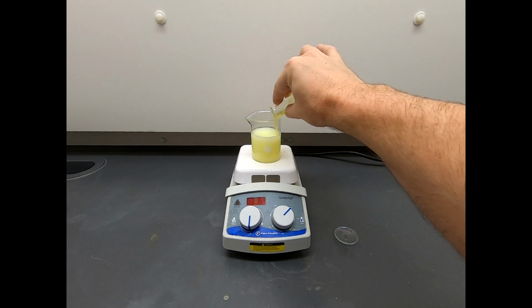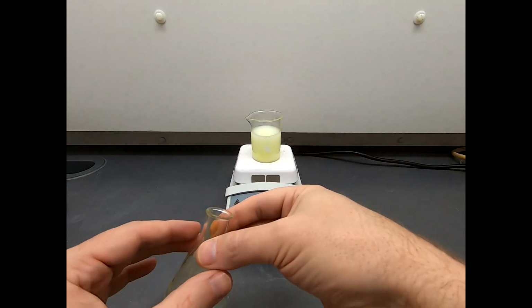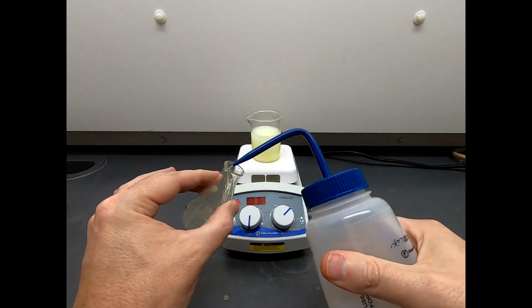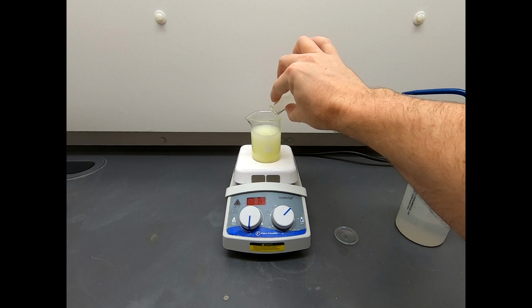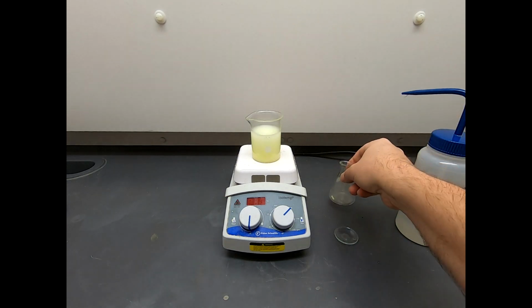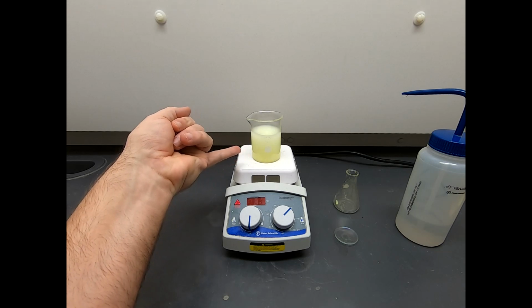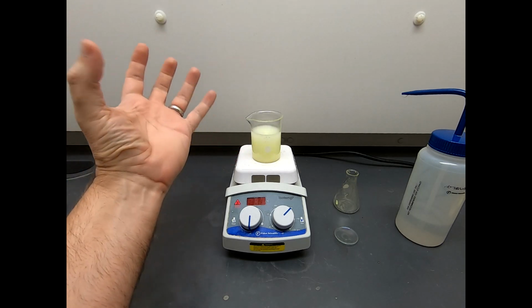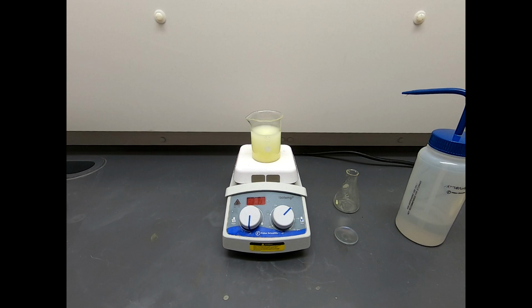And you can see the cloudiness, so no surprise, our product is not very soluble in this aqueous mixture, so we get very cloudy. It's to be expected. I'm going to use just a little water in here to rinse this out. And now we'll let this stir. Toward the bottom, you can see that there are some clumps forming. So this is our product, probably formed in oil dispersion as we mixed it in. And now those oil droplets are coalescing, it's cooling off, and we're getting solid formation. And of course, this is a crude solid, all the impurities are trapped in there as well, but at least we're isolating our crude material. Once this is done stirring, we'll filter this, and then we'll work towards a purification of this crude material.